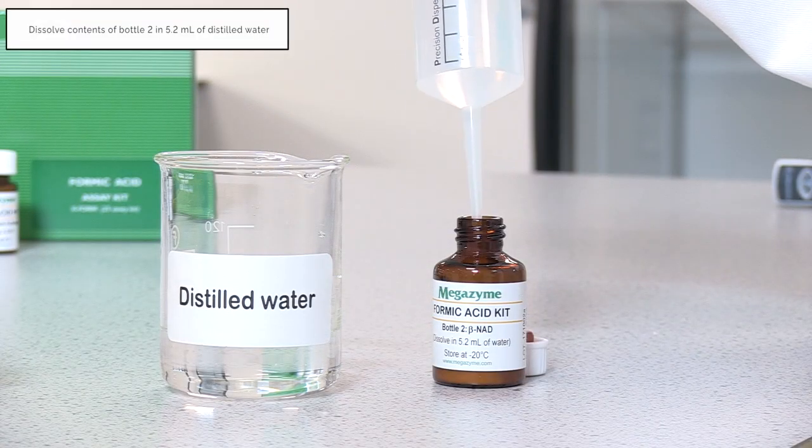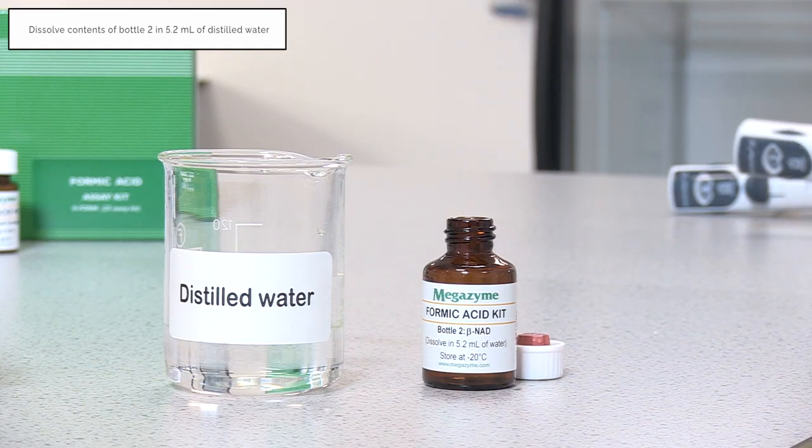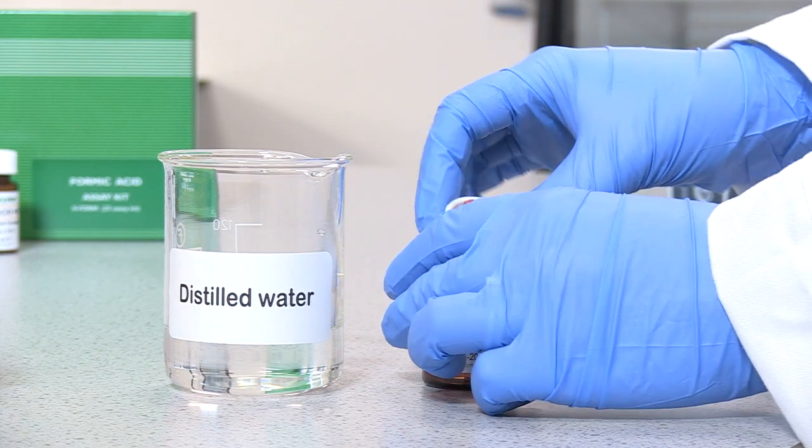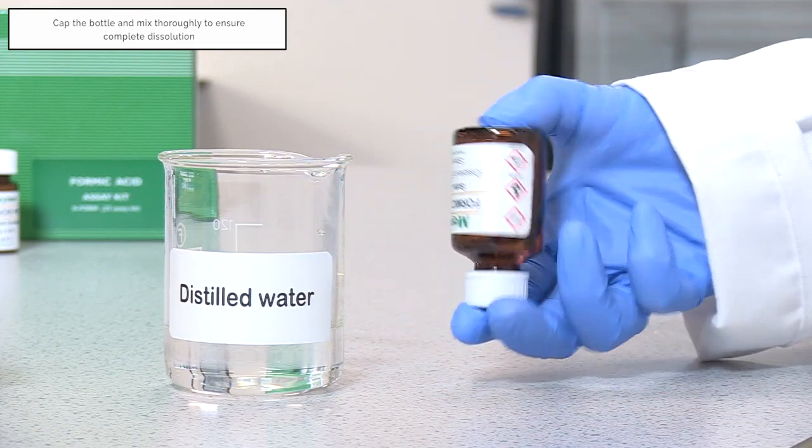The contents of bottle 2 are dissolved in 5.2 ml of distilled water. The bottle is capped and the contents are mixed thoroughly to ensure complete dissolution.